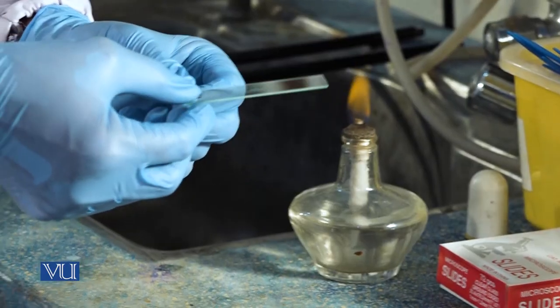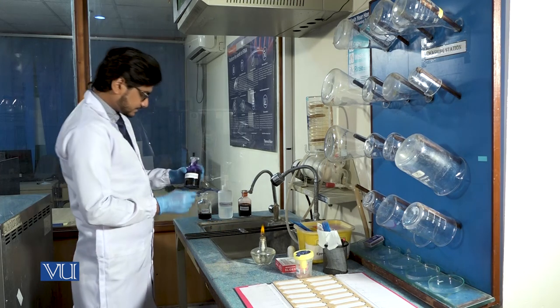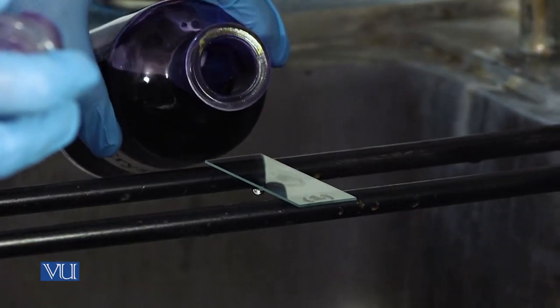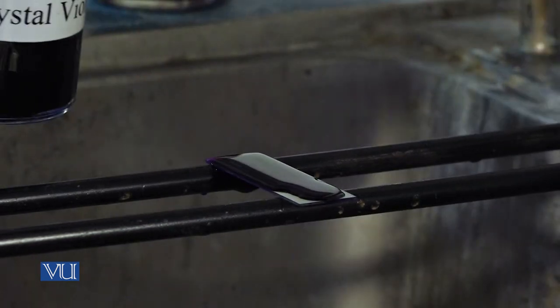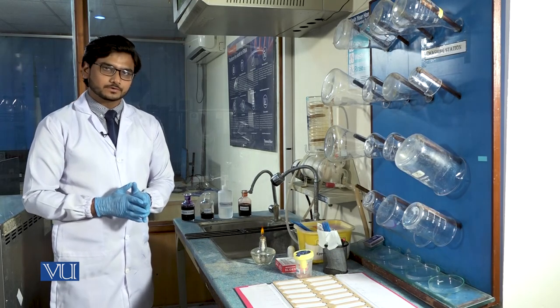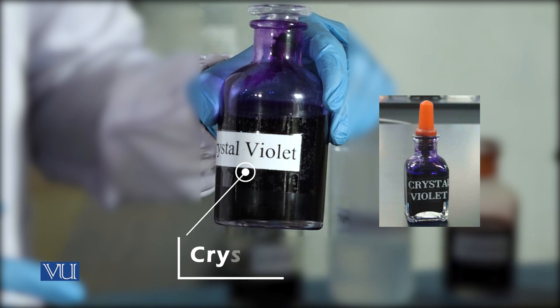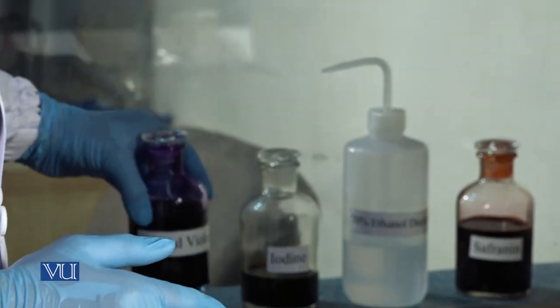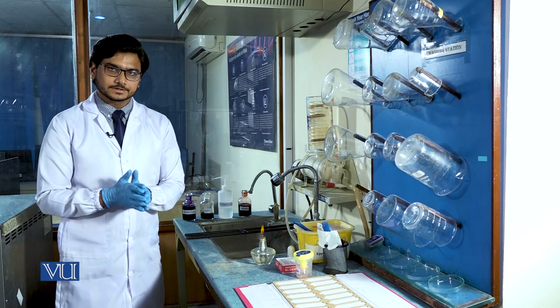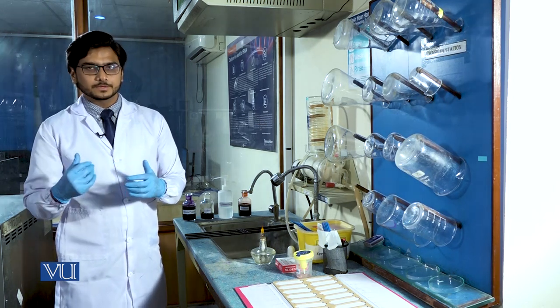After fixation of the smear on the glass slide with the help of heat, we will move towards our first dye which is crystal violet. Flood the crystal violet on the slide for one minute. Crystal violet's color is purple. Because gram positive bacteria have more than 60% peptidoglycan in the cell wall, the crystal violet is retained in the cell wall — gram positive bacteria will pick up and retain the dye. Therefore, gram positive bacteria appear purple in color under the microscope.